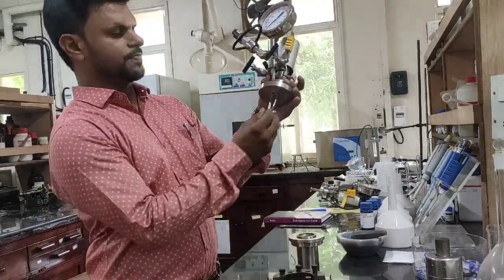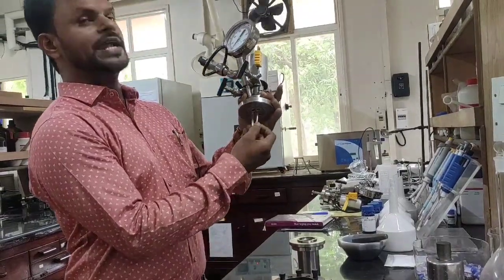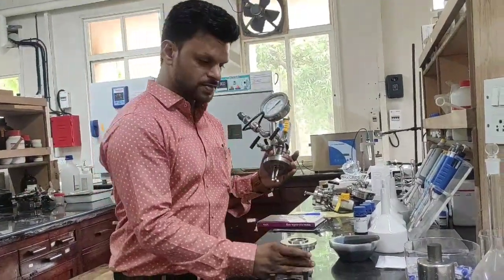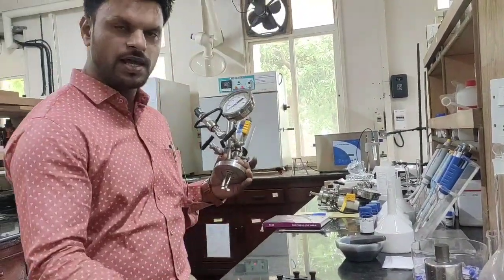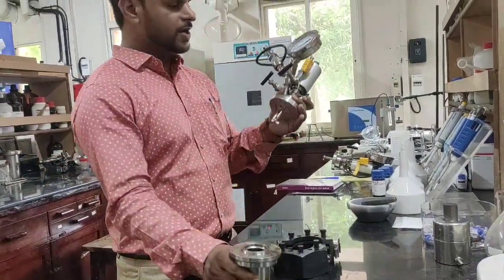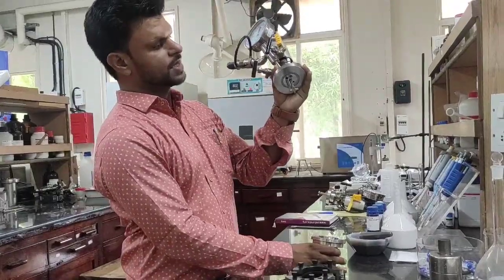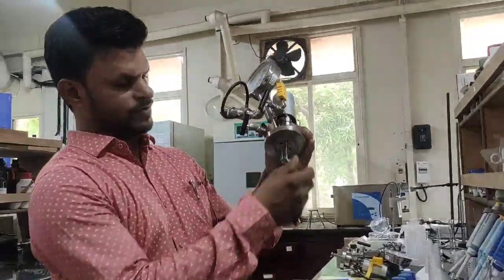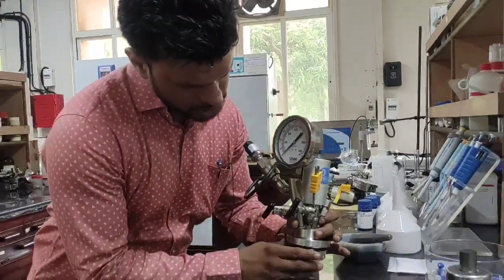This is basically a stirrer. So if you are planning to carry out some reaction, you add your material, catalyst, your solvent, your reactant and you have to close this. With the help of the stirrer, this will help for stirring purposes.